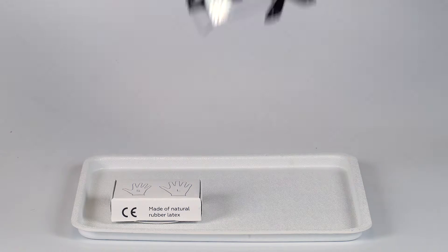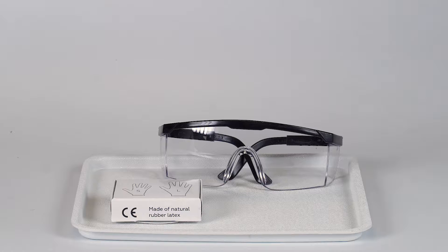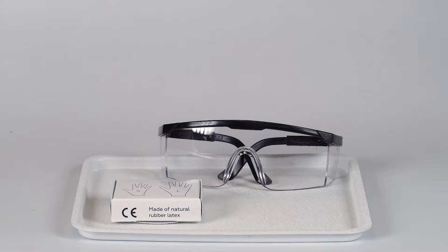Perform this experiment on a plastic tray to contain any possible spills. Don't forget to put on protective goggles before doing the experiment.